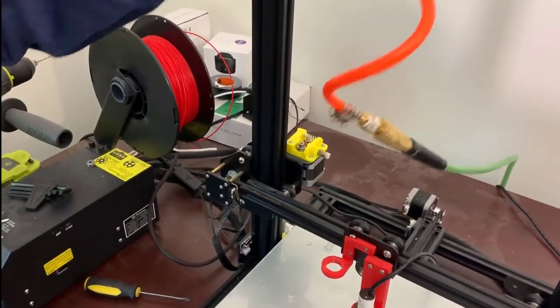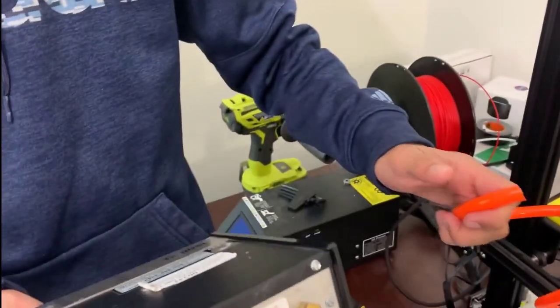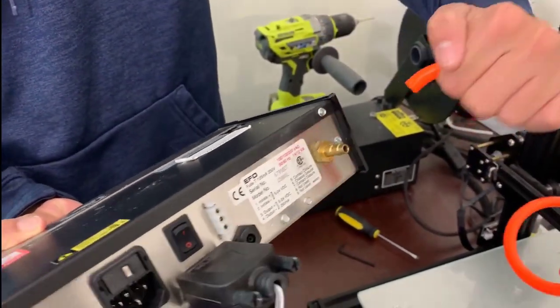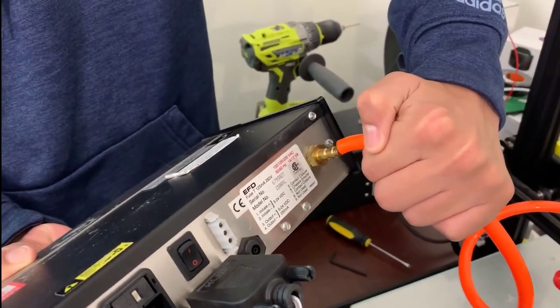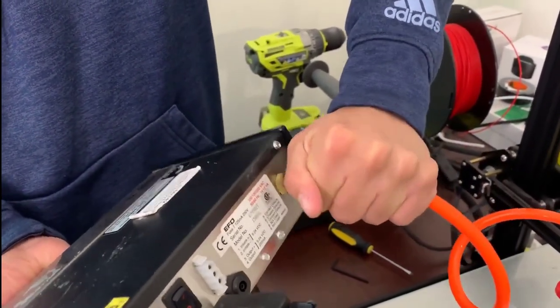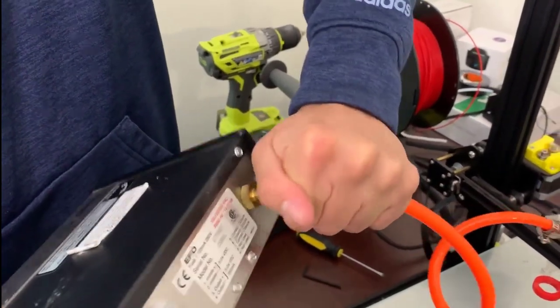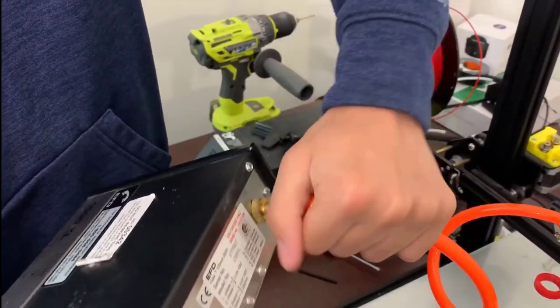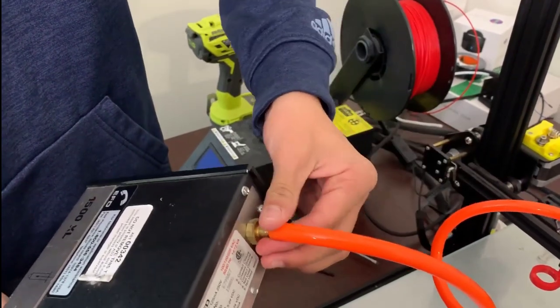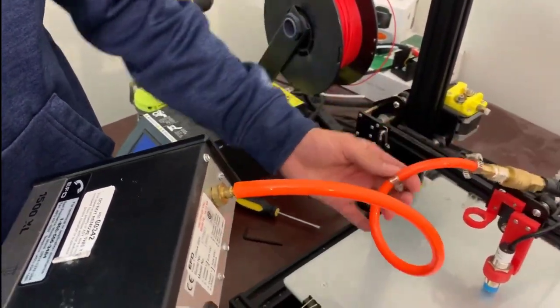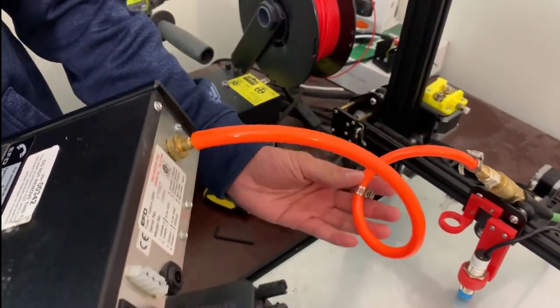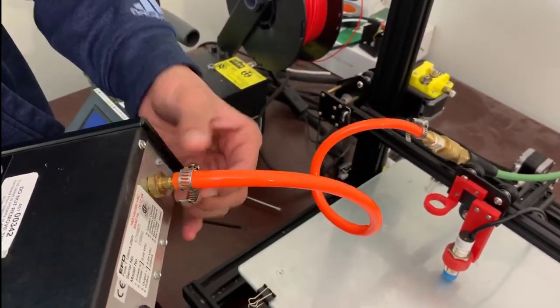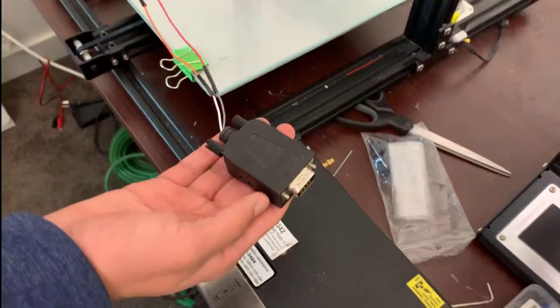So now that most of the preliminary stuff has been set up in our extruder system, we're just going to jump to now start setting up the EFD dispenser. So as you can see, I'm using this tubing that connects to our air compressor and hooking that up to the EFD dispenser. I'm just making sure it stays on tight because you don't want any air to come out. So there's a port on the back of the EFD dispenser as you can see that will connect right to the air compressor. And using a clamp, we're going to make sure that the actual tubing doesn't come loose.